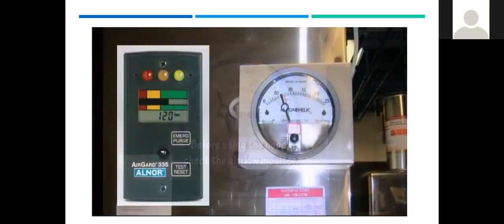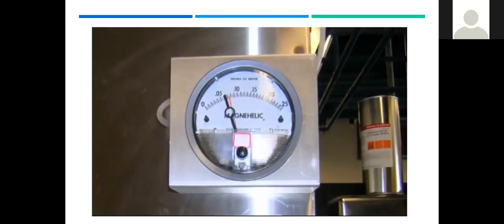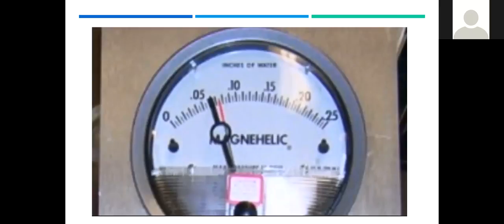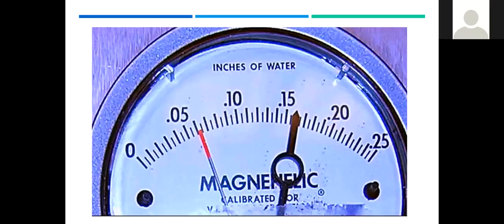One should always check the quantitative airflow monitor or alarm to verify that airflow for the fume hood is proper. There are two types of airflow monitors used on campus fume hoods, digital monitors and differential pressure gauges. Digital monitors display air velocity into the hood and should read more than 100 feet per minute. Differential pressure gauges measure the difference in air pressure between the room and the hood's exhaust duct in inches of water. The red indicator should be inside or above the circular target. If the hood airflow monitor indicates low airflow, contact your department safety coordinator, EHS, or physical plant for maintenance.